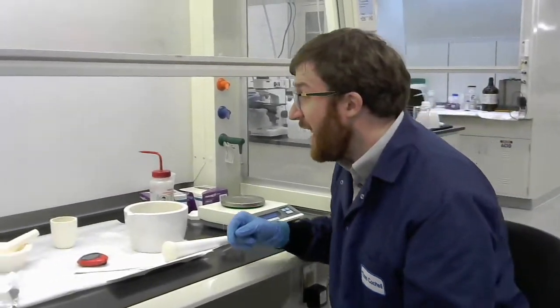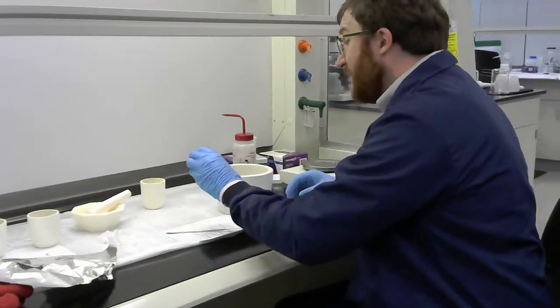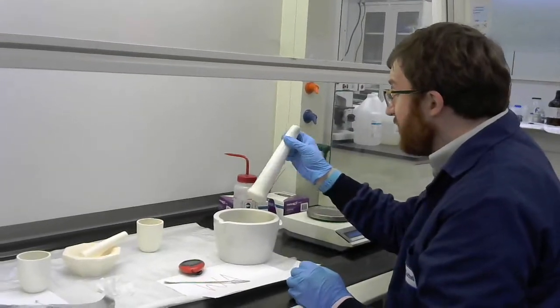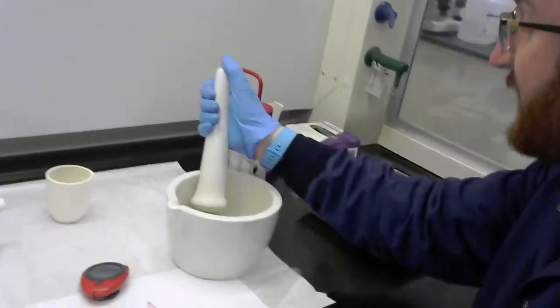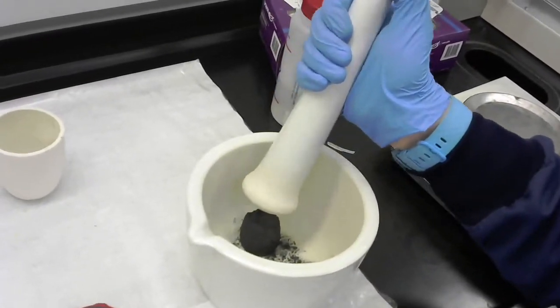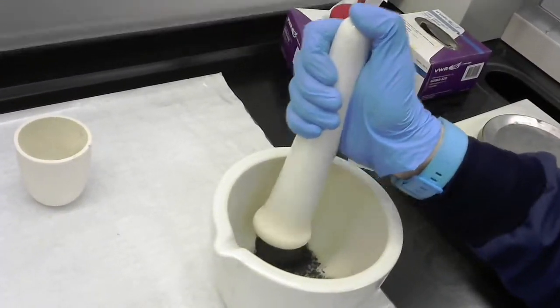That's a good one to look up to see what the size is as you're going along here in the videos. Because that's going to be our sort of final state. When it passes through 325 mesh that's going to be what we're aiming for. Alright so I'll go ahead and start this. So I'm going to start my timer. Sorry my stopwatch. And then I'll let Antonio get over here just so you can kind of see the initial parts of this. But initially it's pretty hard.